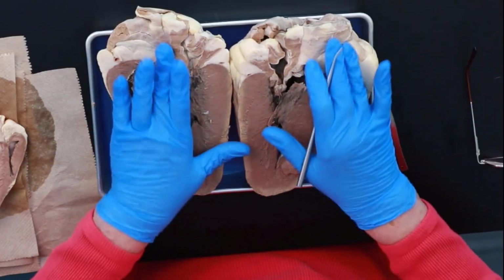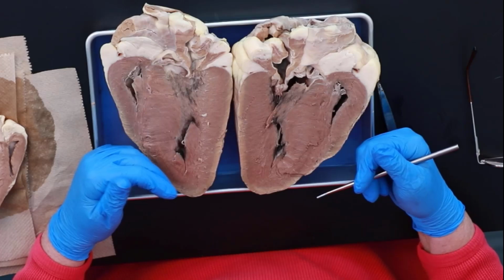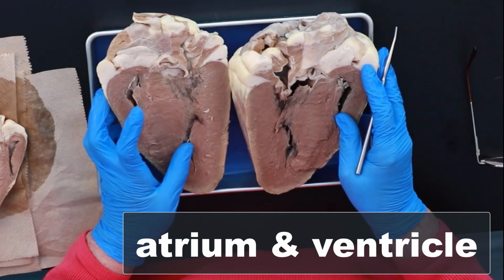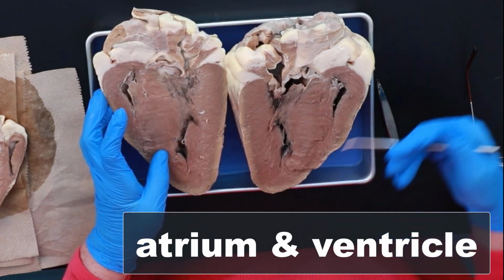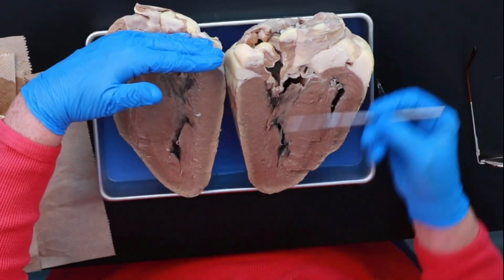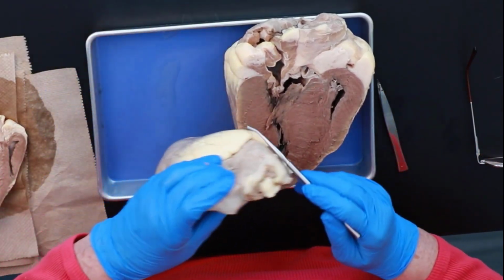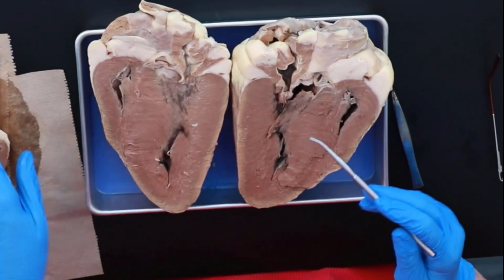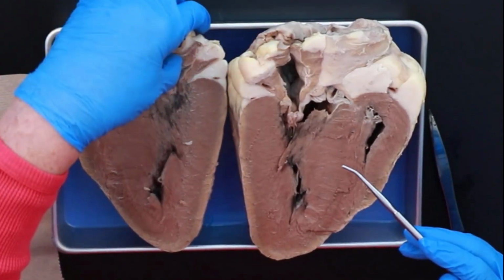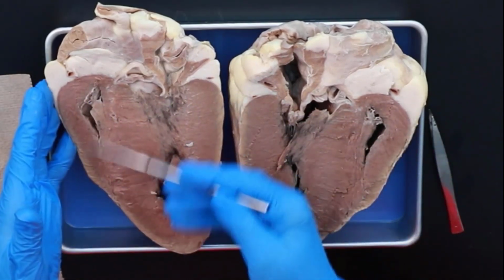So once you've got the sides done in terms of left and right, then you want to look at the chambers. And you know you have the atria and the ventricles. And if you look at this heart, what I almost all see is ventricle. All of this from here down is ventricle. These little guys up here, that's your atrium, and I'll show them to you more over in the sheep's heart. But this is atrium here and here. So all of this is ventricle.